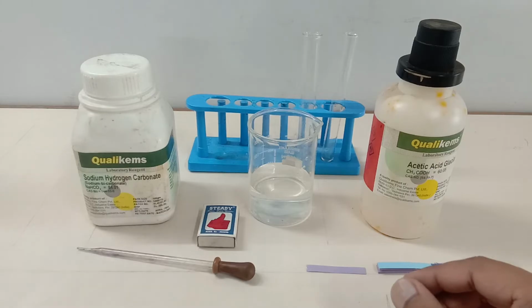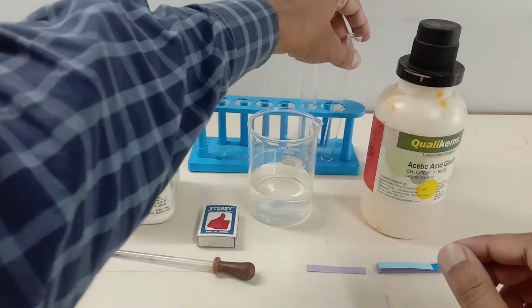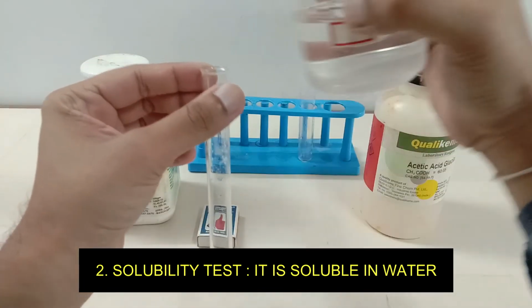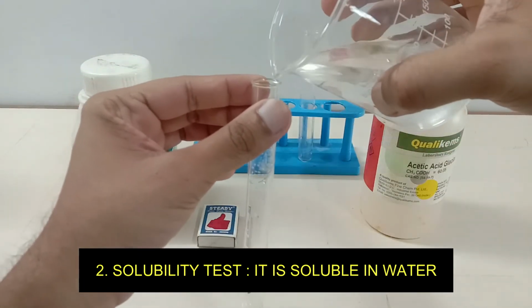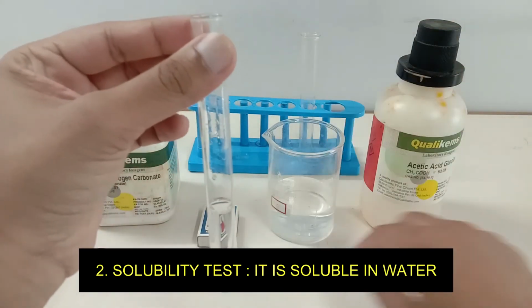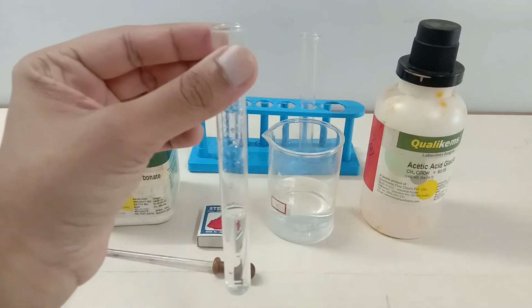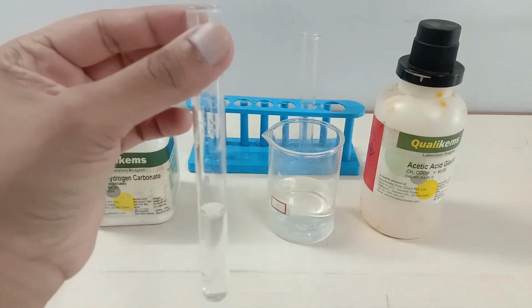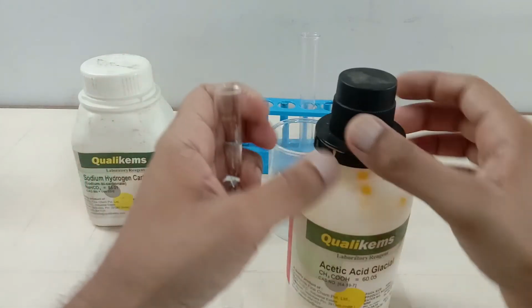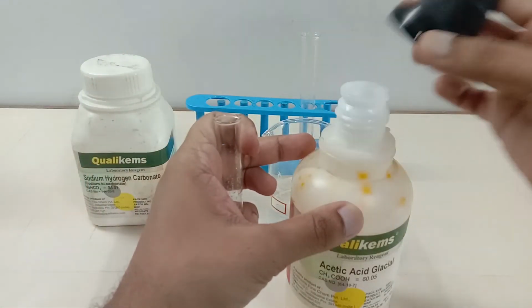Now the next thing I'm going to demonstrate is the solubility. So I'm going to take a test tube. Then I'm going to add some water in it. Then I'm going to take some acetic acid with the help of the dropper.